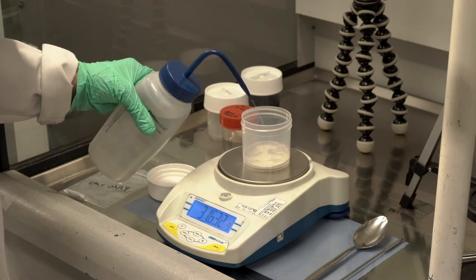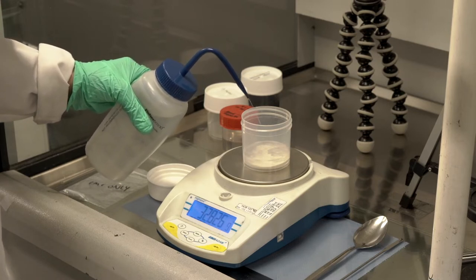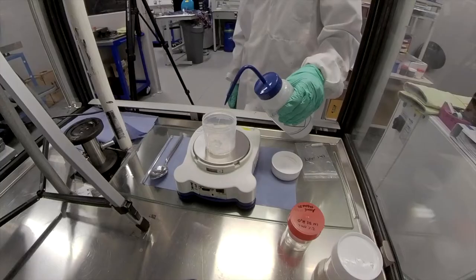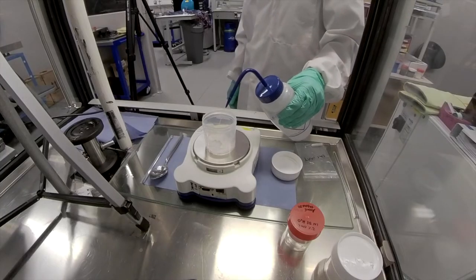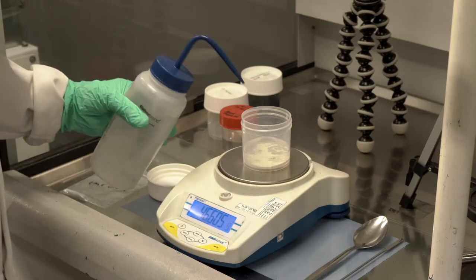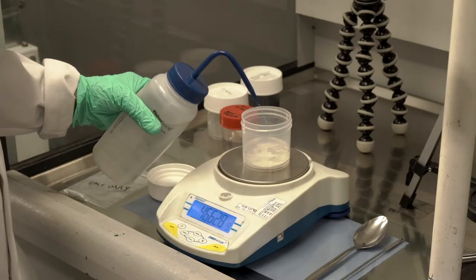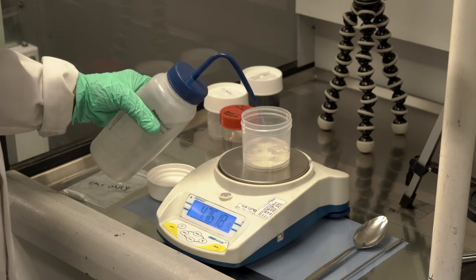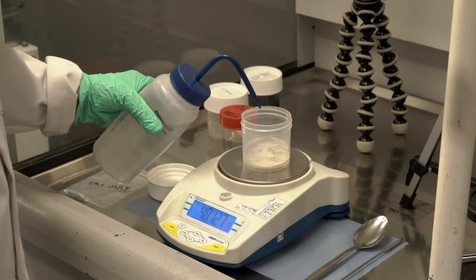Once I have a homogenous CMC solution, I can use it again and again for several batches of my slurry. I also tend to err on the side of too much water, since I know there will be some evaporation before I'm finished with the stirring.